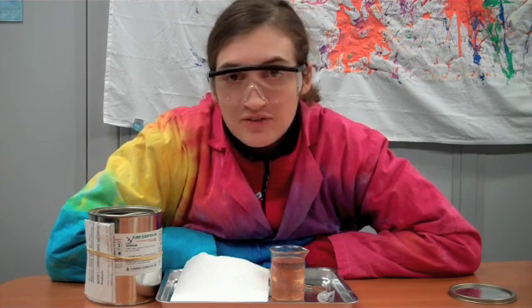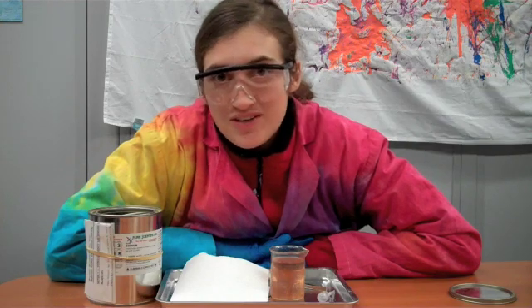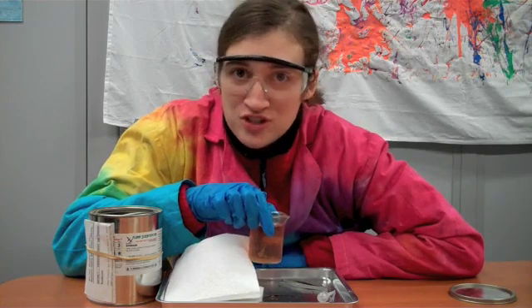It's an experiment that I'm testing out for an off-site program, but I thought it might be fun, so I'm going to show it to you anyways. What I have here is just some water, but I added some cabbage juice to it.